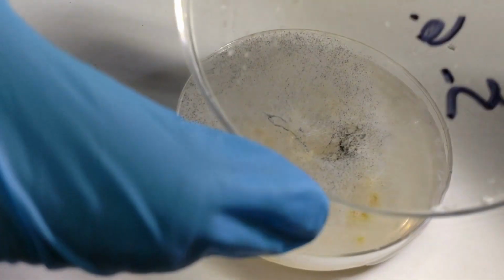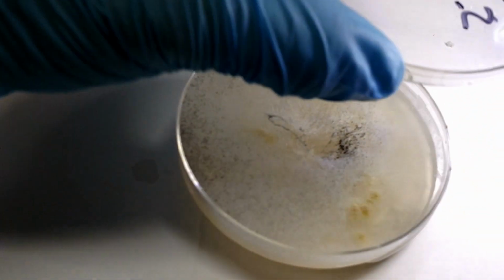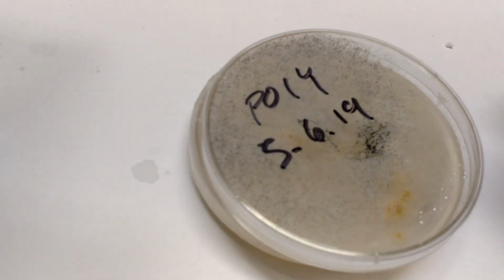And you can see where it's even hitting the top of the dish and sporulating. Ugh. Okay, now I've got to go clean up. I feel filthy.